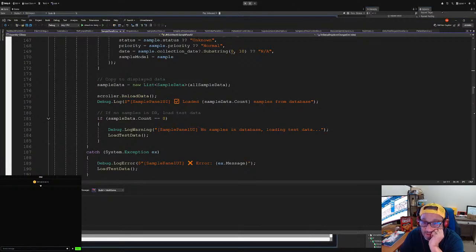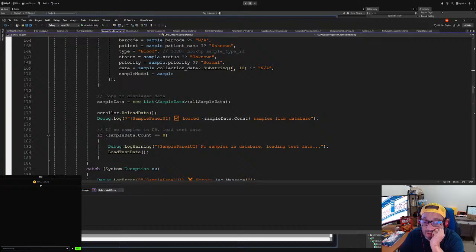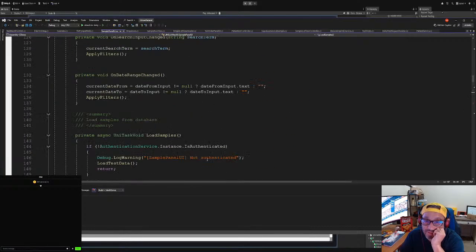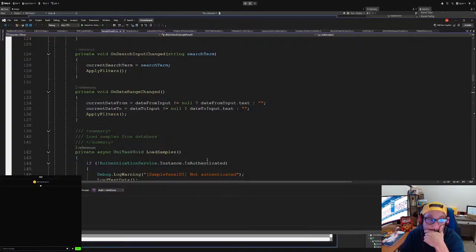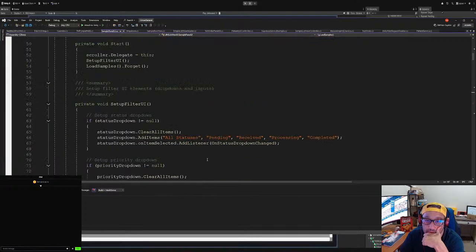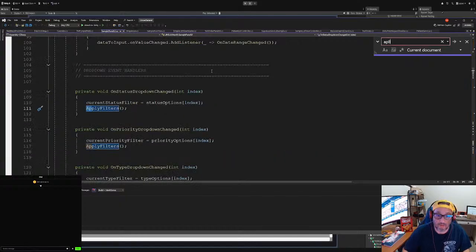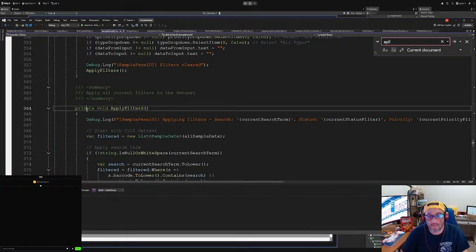I see what we did. Input, date from input. No, we don't need that. Actually, we didn't need it. But we're gonna apply the filters anyway. There we go. Apply filters. We're gonna make this public.